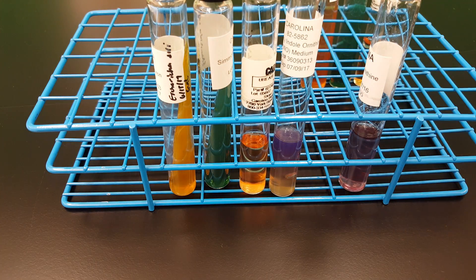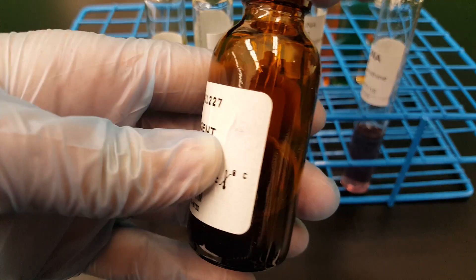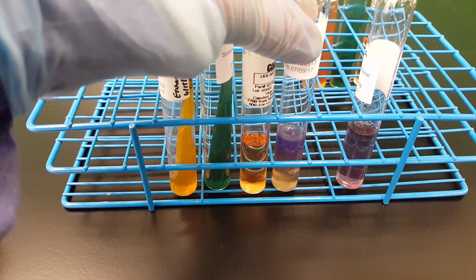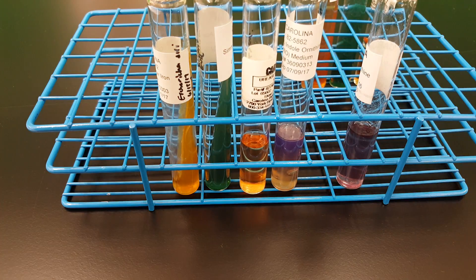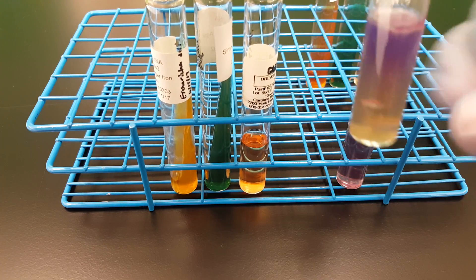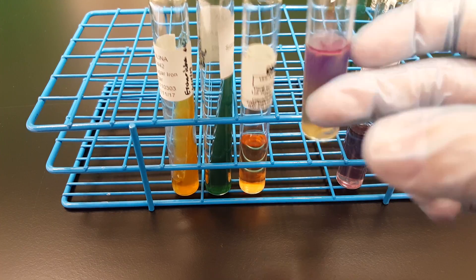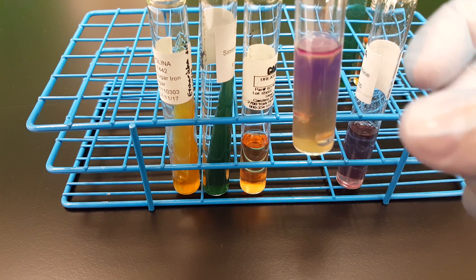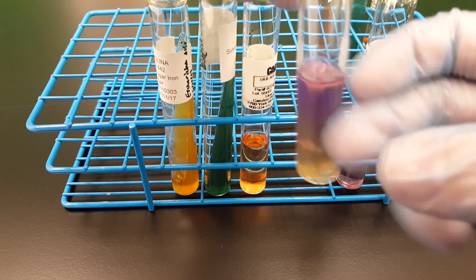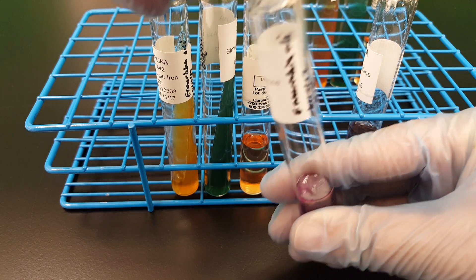Now I'm going to add my Kovacs reagent. I swirl the Kovacs reagent, pull the fluid into the dropper, and add three to four drops into the MIO tube. Now we're going to flick it. You can already see the pink forming up top — see the pink up here? That means E. coli does deaminate the amino acid tryptophan, which is provided in the agar itself. That's why we have to flick it — if we did not, the indole present from growth in the tube would not be liberated into the reagent dropped on top.